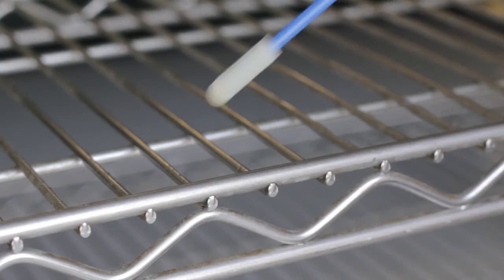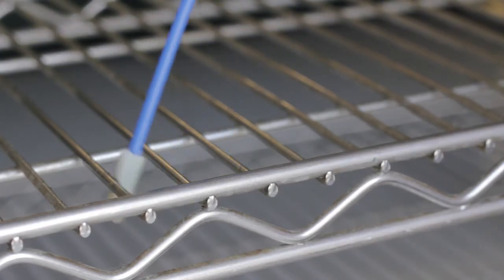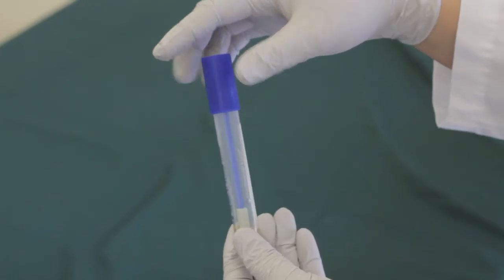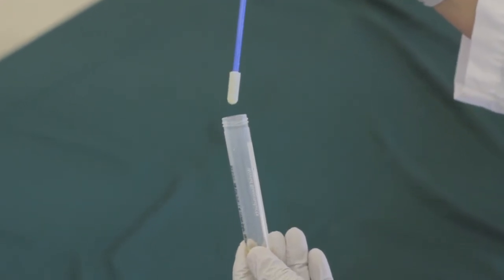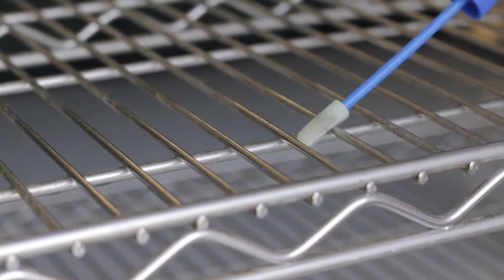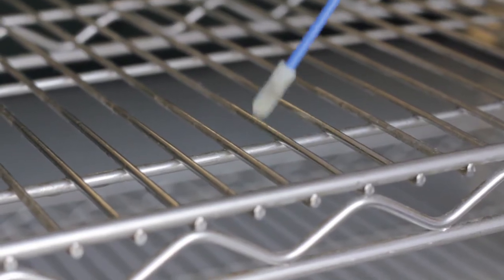On small surfaces or hard-to-reach areas, use the Q-tip swabs to take your environmental samples. Remove the Q-tip from the vial without touching the inside of the vial or swab shaft. Swab the area with heavy pressure to ensure that the Q-tip is picking up the sample from the environmental surface. Return the swab to the vial and ensure that the cap is secure to prevent any leaking.